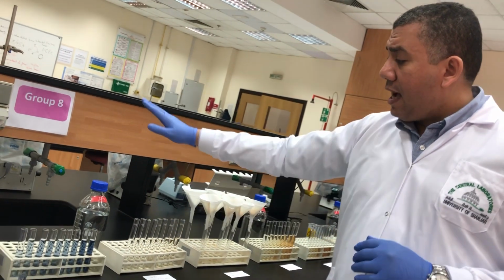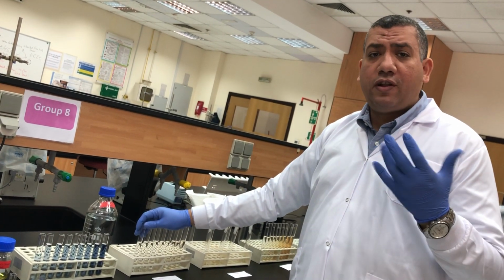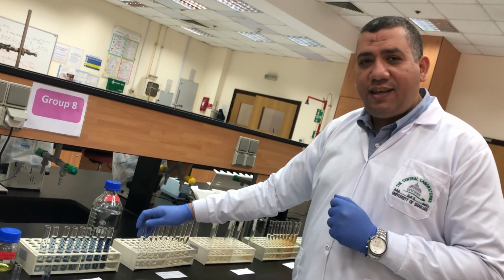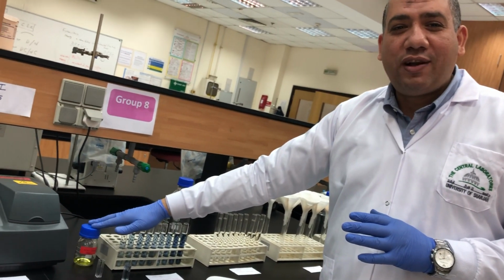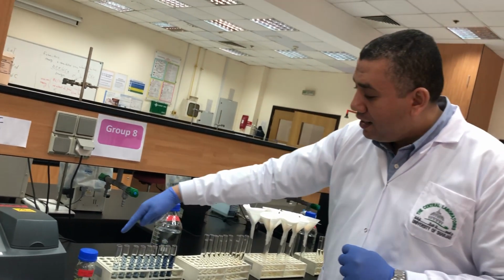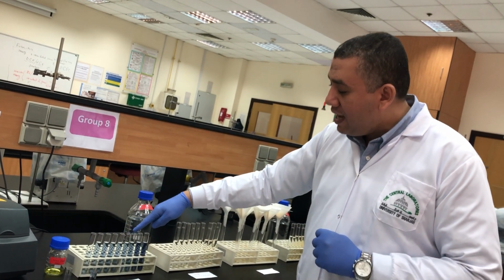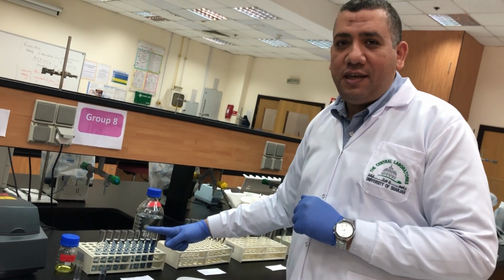At the same time, I will add 8 ml of NaOH here. So I will have 5 ml of filtrate plus 8 ml of NaOH. So I did the media. After that, the last step: I will add the Folin reagent, which gives us the color with the polypeptide. So the color gradually increases until the last 3 tubes become fixed, which is called Vmax.